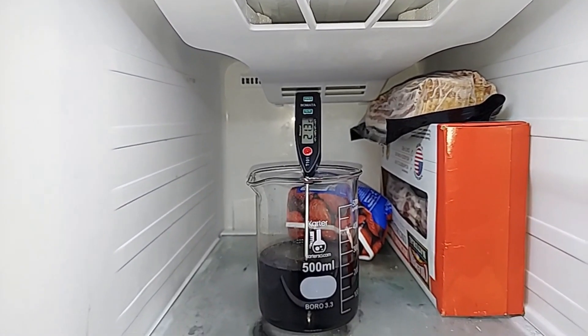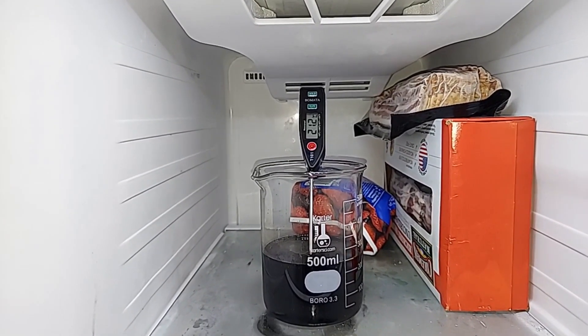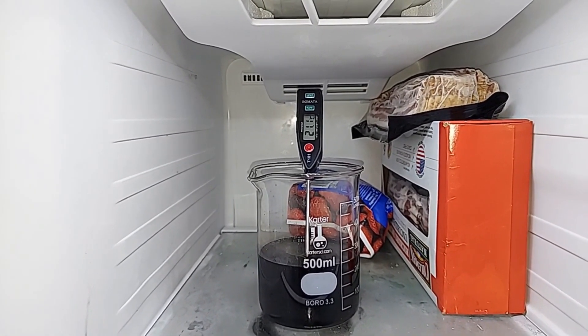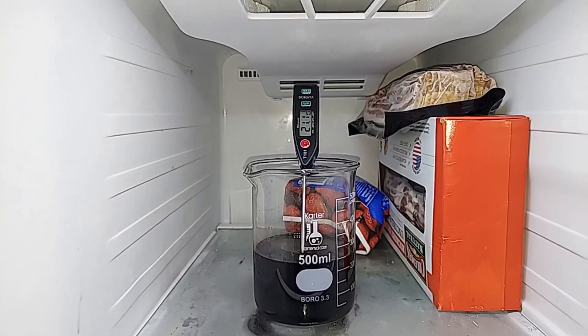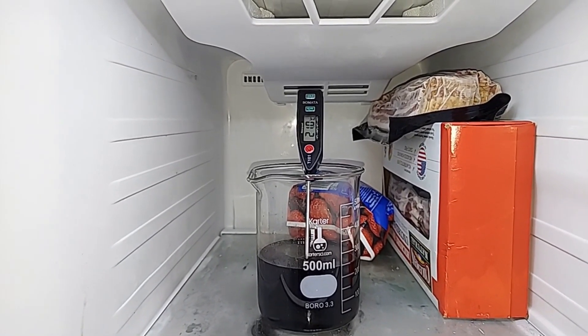We're looking for zero degrees Celsius. At 21.3 degrees Celsius now, of course that's going to drop. By the way, stainless steel does not react with potassium permanganate, so there's no problem putting that thermometer in there.